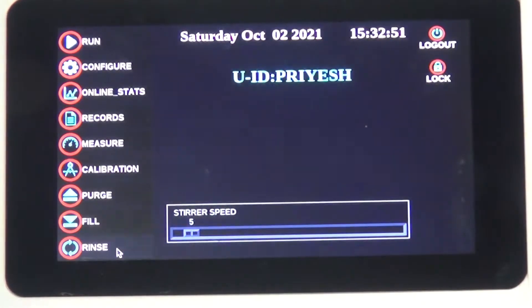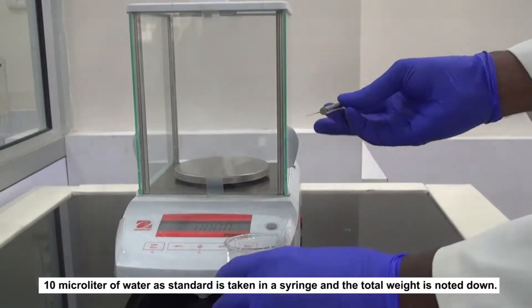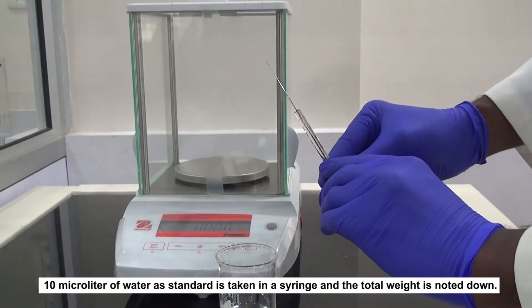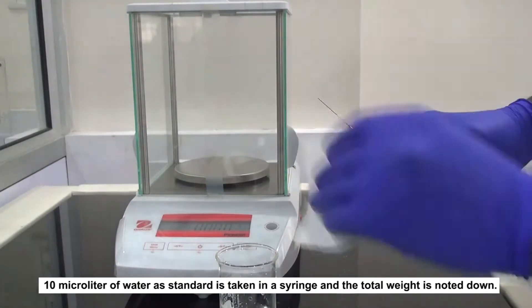10 microlitres of water as standard is taken in a syringe and the total weight is noted down.